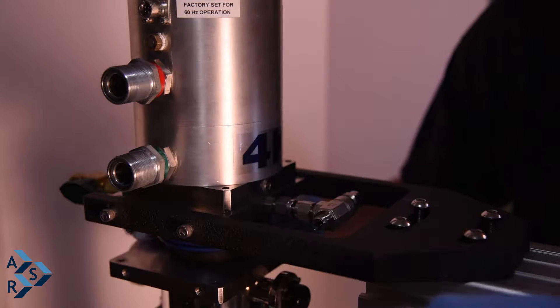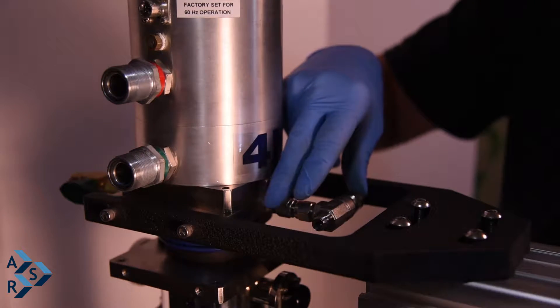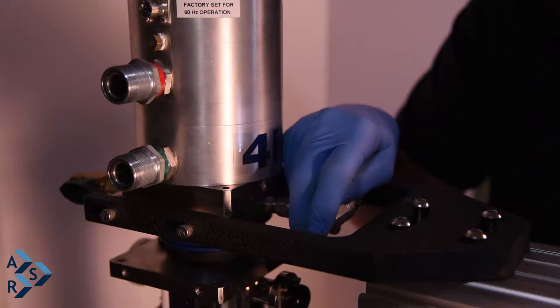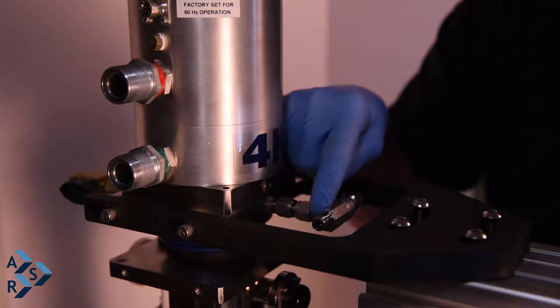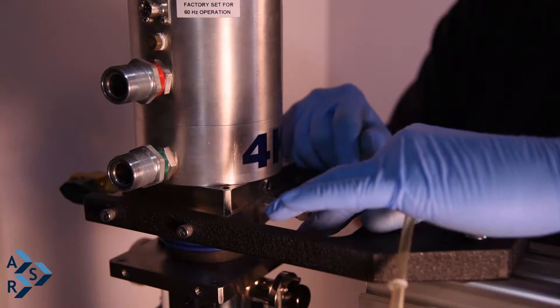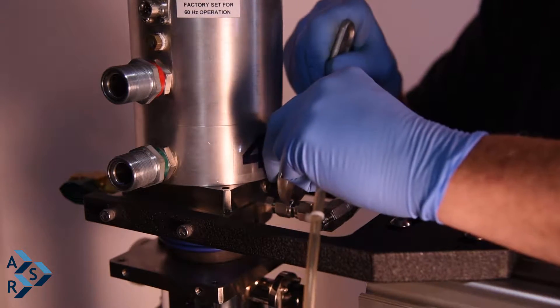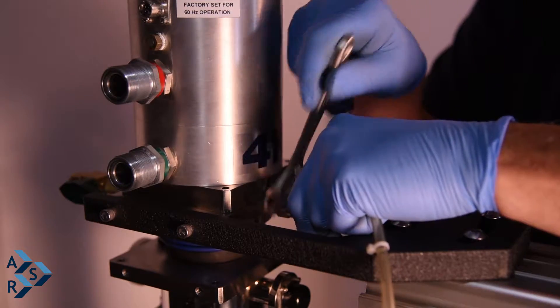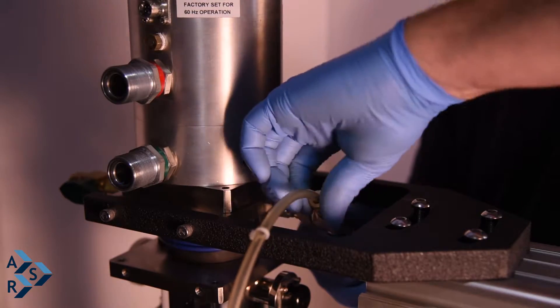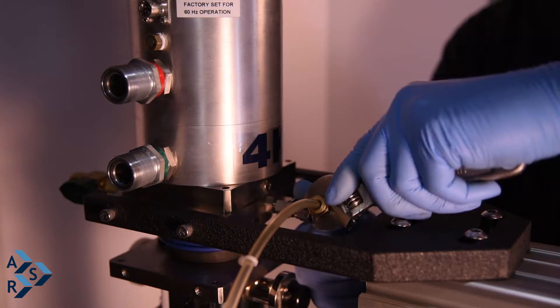We're going to charge and vent the bellows in between the interface and the cryostat. Normally this is how it's set up: you have a one PSI relief valve and helium gas going into the annular space through a quarter-inch compression fitting. In a tight fit between the forks, take an adjustable wrench, break that connection, angle it up, install your feed line for the helium gas, and tighten it down snugly.